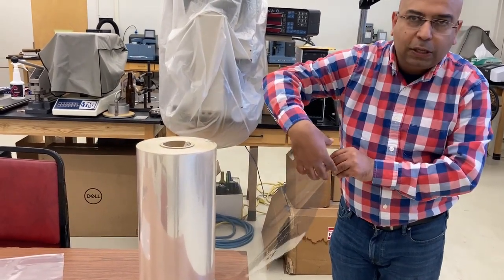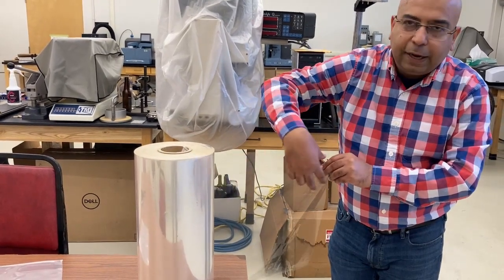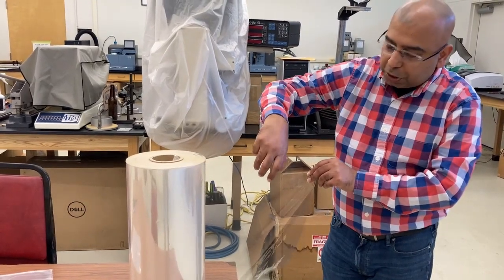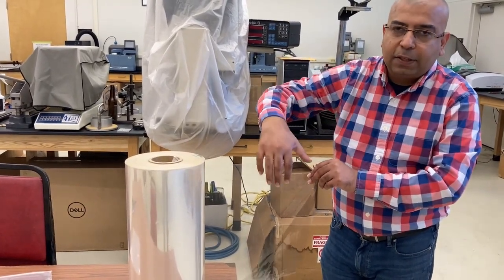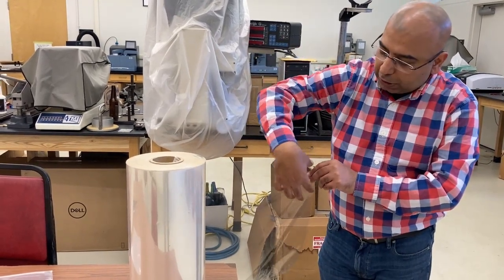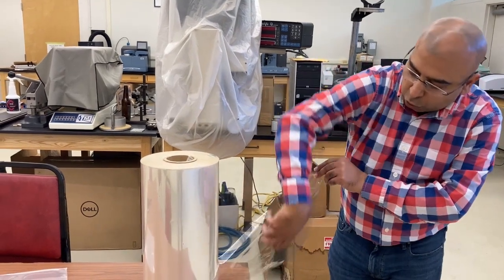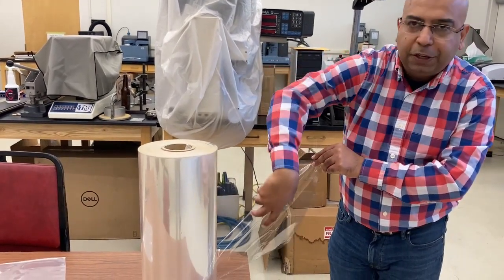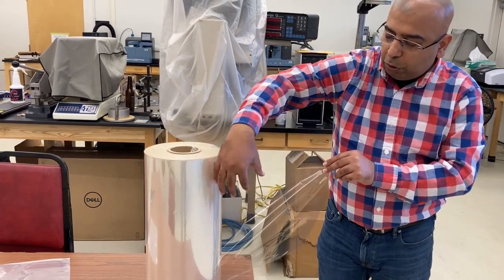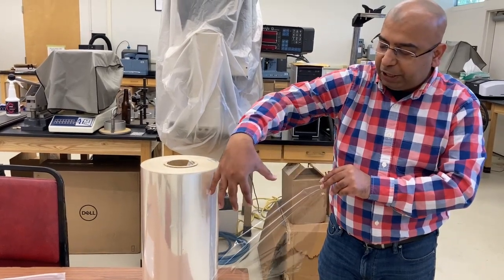So the molecules and the polymer chains primarily align in the machine direction. Now sometimes we have processes, sometimes we have accessories to orient the molecule in the other direction as well. So this is your primary direction of the orientation of the molecule, but then we can also orient in the other direction as well. This primary direction of the orientation of the molecule, in which the polymer naturally tends to flow, is called machine direction.